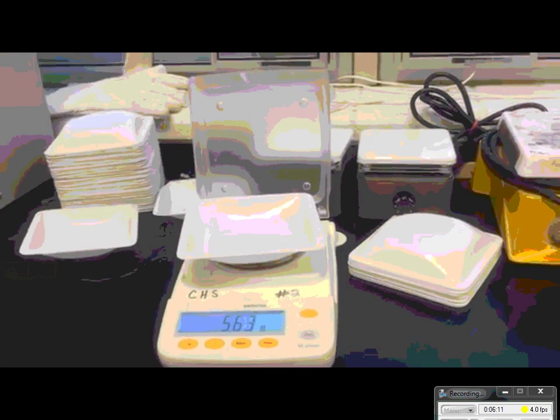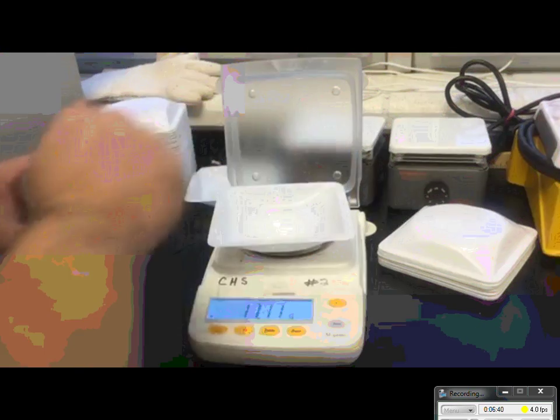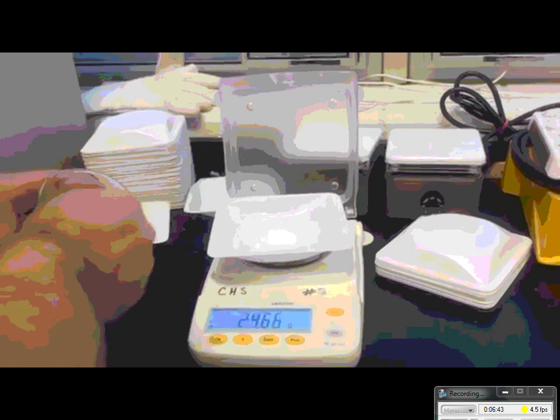I'm going to put a measuring dish on the scale. The measuring dish measures out 5.64. Now I'm going to zero the scale, so now it's not reading the effect of the measuring dish on the scale. So when I'm adding my salt, I know that the only thing that's being measured is the salt. So now I need to add 36.53 grams to get as close as possible as I can to that. I'm probably not going to hit it exactly, but I could get pretty close to it.